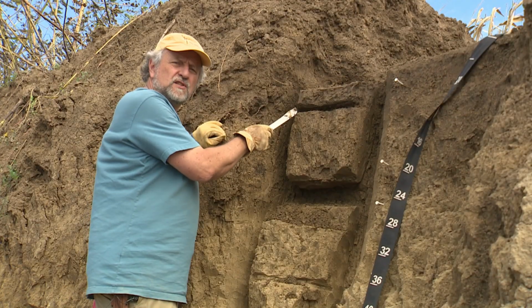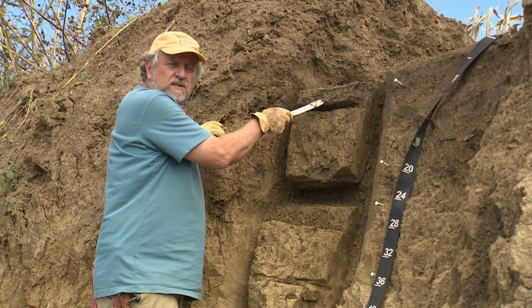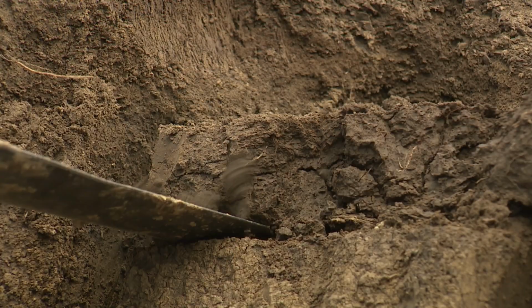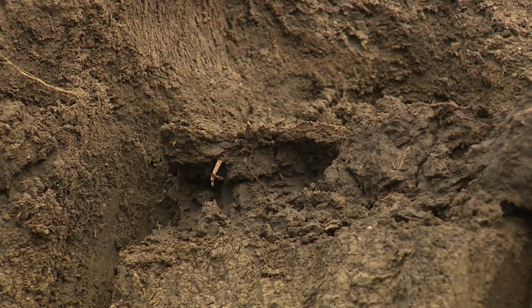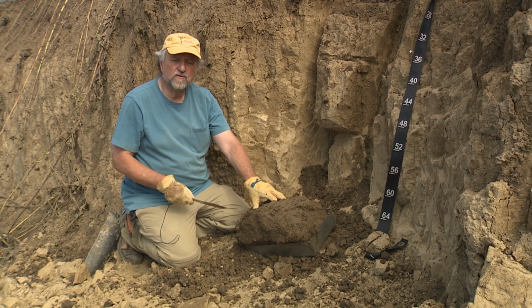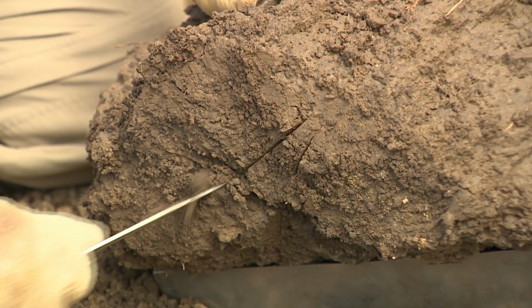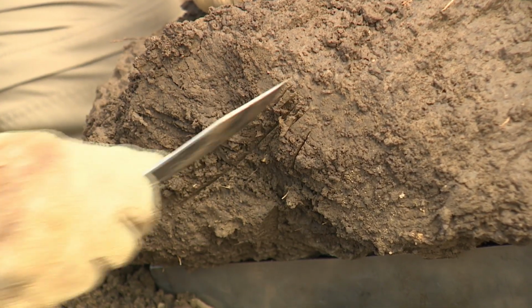In a situation like this, where you have a thin layer which is still viable for extracting clods but is on the thin side, as you work up from the bottom, if you remove the supporting column underneath, this upper thin layer may well collapse on you. So it's customary to go ahead and extract that one first so that it isn't in danger of being lost. For very large chunks of soil like this, if it's going to be moved off site to be prepped, trimmed, and whatnot, it's convenient to mark the top with an X or some other symbol so that orientation can be maintained if subsequent samples are going to be taken for thin section.